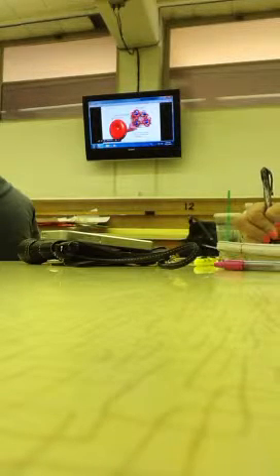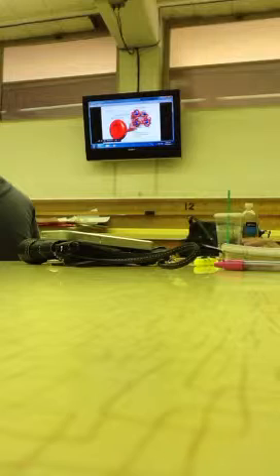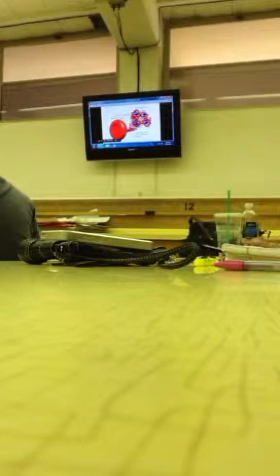White blood cell. Okay, this slide here, I just want to remind you, so red blood cells carry a whole lot of hemoglobin. And each of those hemoglobins have 4 binding sites for oxygen. Okay.